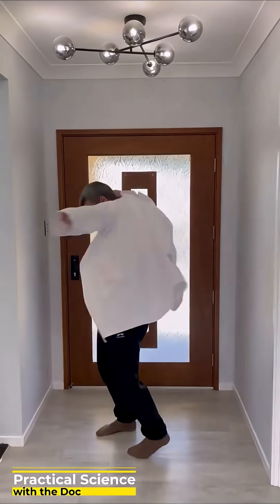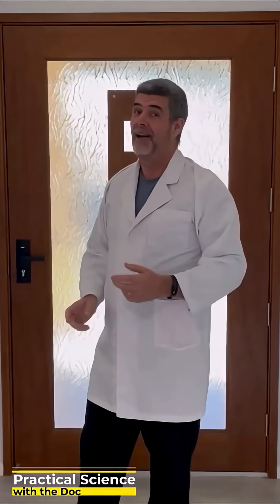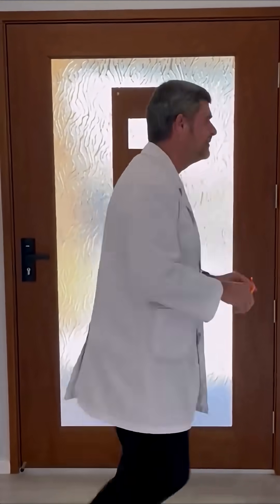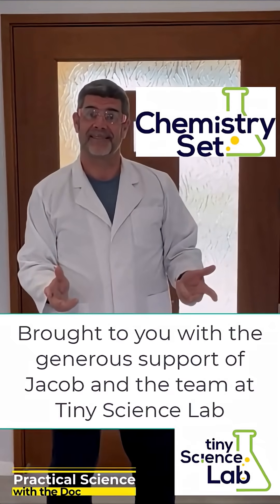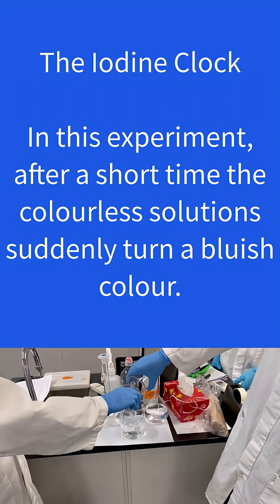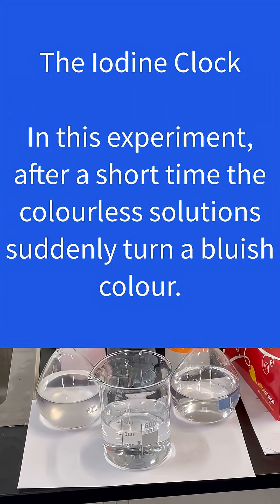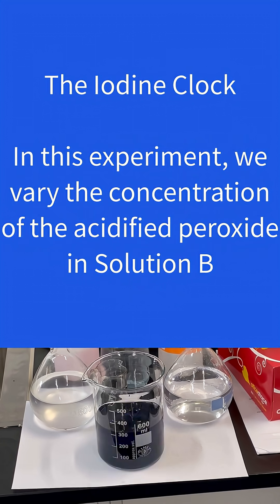Hi students, I'm the Doc and this is Practical Science. There are several factors which can affect the rate of a chemical reaction. We have already considered temperature and surface area. Another factor which can increase the chances of a collision between reactants is concentration.